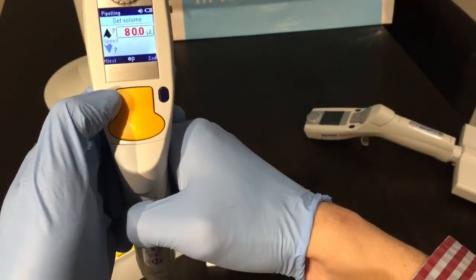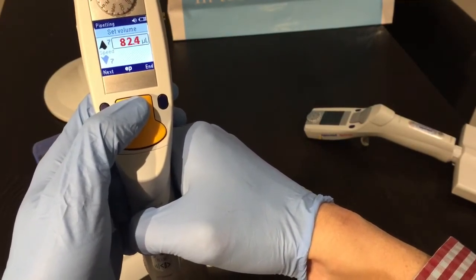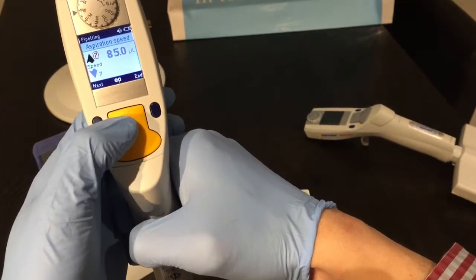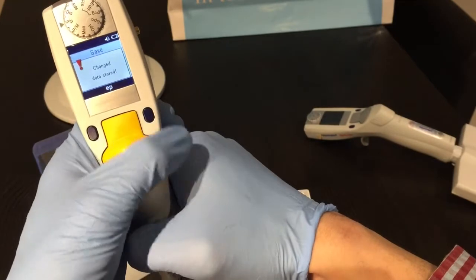Let's start with pipette mode, PIP. I'll press the soft key for edit and change the volume to 85 microliters. There are eight different speeds, so let's set the fastest speed for both aspiration and dispensing, then press end when ready.